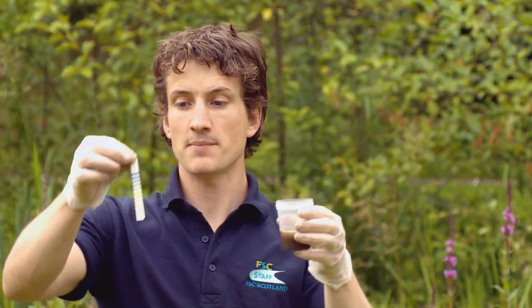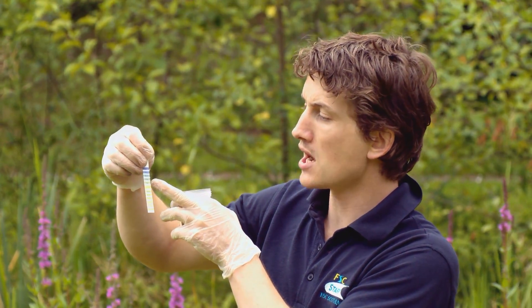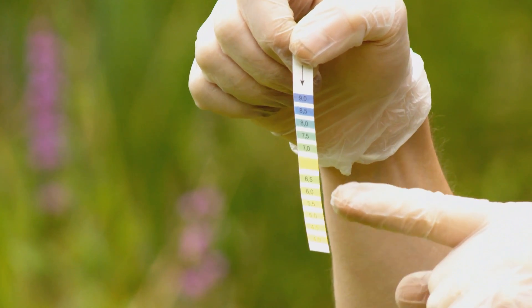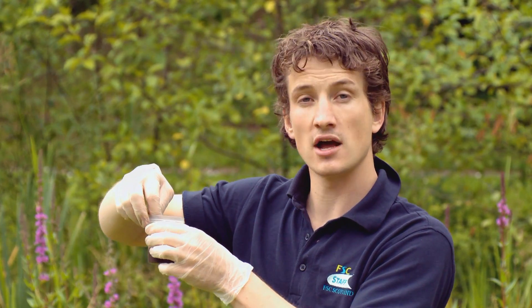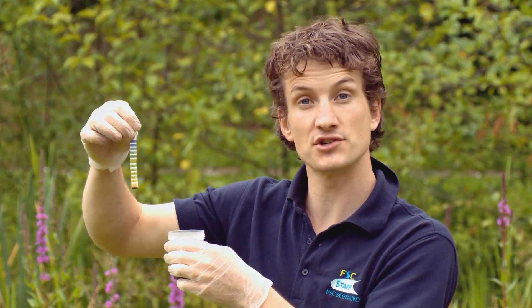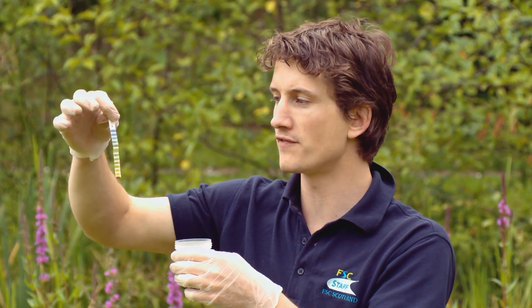Once I've got my soil sample, I'm going to test the soil pH using this colour-coded test strip. The darker blue and purple values indicate an alkaline soil; the green and yellow values indicate a more acidic soil. I'm going to dip the middle part of the test strip into the soil sample so it's completely submerged, waiting for three seconds before pulling it out. If there's lots of soil on your test strip, give it a wash so you can see it clearly. You should also wait about two minutes, because the colour change can take a little while before you read the value.